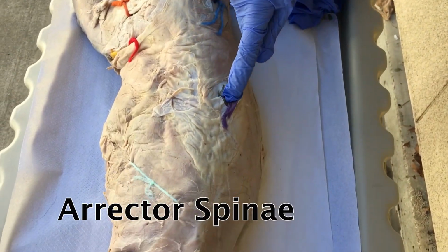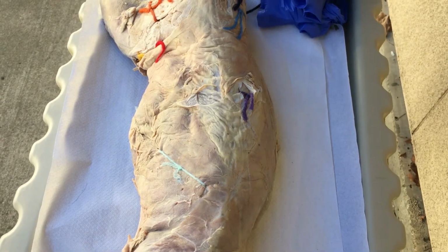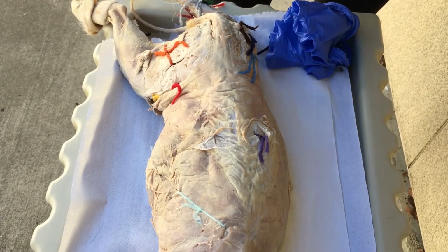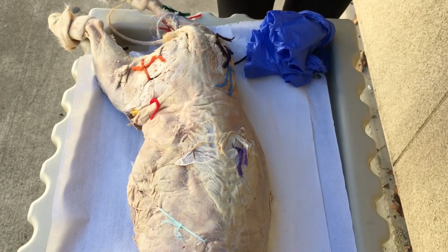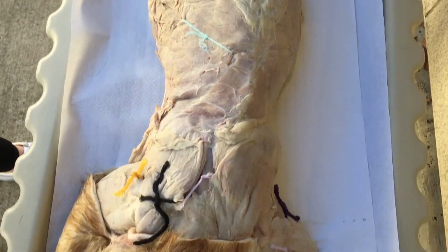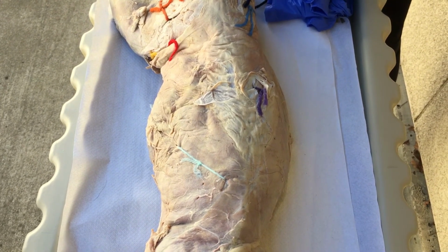Okay, this is the erector spinae in the lavender color here. And this muscle runs along both sides of the vertebral column. The action of this muscle is to extend the spine, and its antagonist is the rectus abdominis, which flexes the spine. And the erector spinae is composed of many different muscles, so its origin ranges from the sacrum to the cervical aspect of the vertebrae. Its insertion ranges from the skull as well as the cervical part of the vertebrae. A way to remember this is erector means straighten, and spinae sounds like spine, in which the erector spinae straightens the spine.